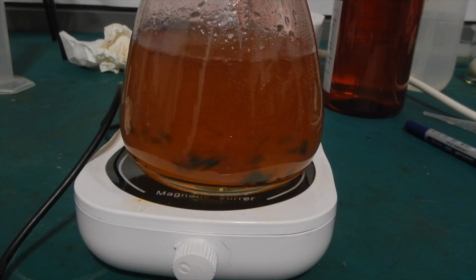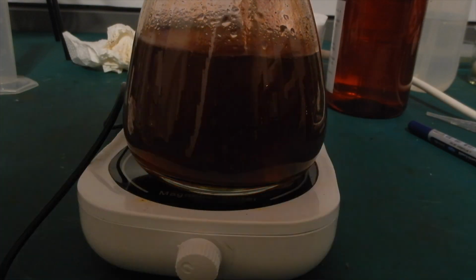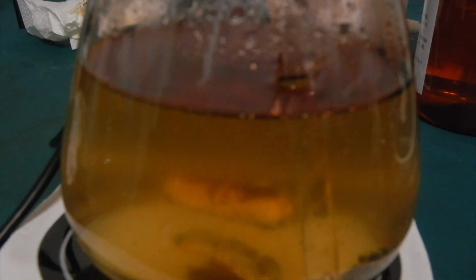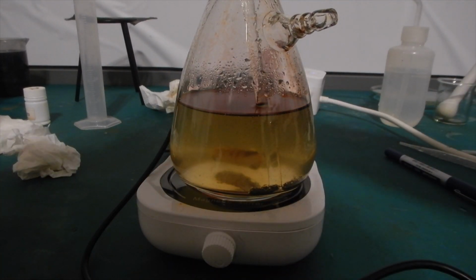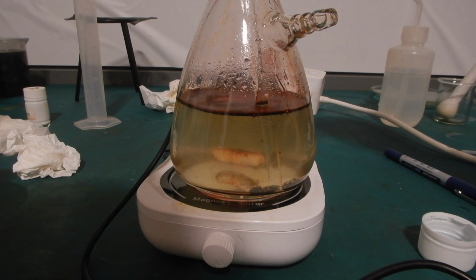Iodine cannot dissolve well in water, but it readily dissolves in diethyl ether. The ether then extracts the iodine from the water phase into the organic phase. When the stirring is stopped and the solution settles, you can clearly see a dark red layer of diethyl ether floating on top. Most of the iodine has dissolved in it, and the color of the water phase became a lot lighter. I then added some more hydrogen peroxide and continued to stir the mixture.